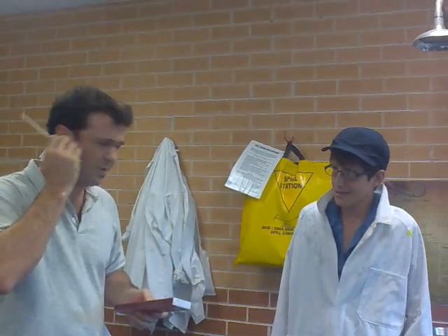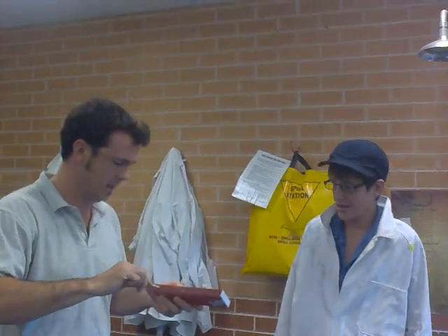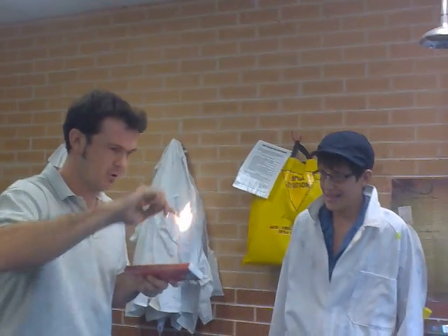Now, okay. If Tom is in fact organic, what's going to happen again? I don't know. Let's just find out. Ready? Okay. This is going to be good. Sir, don't!